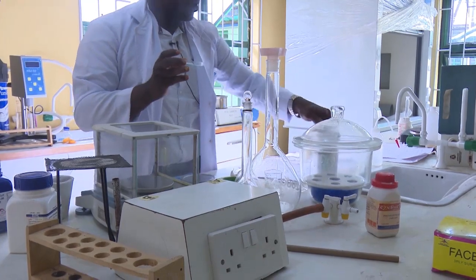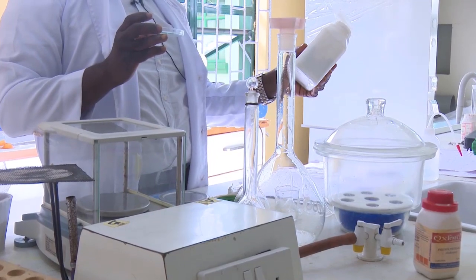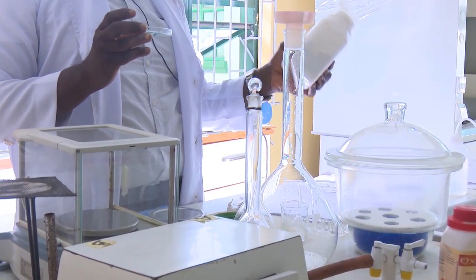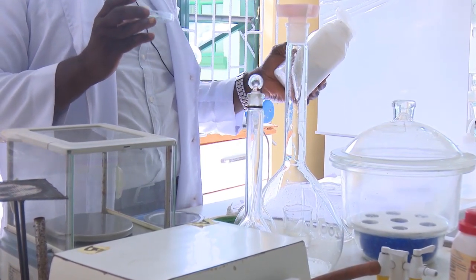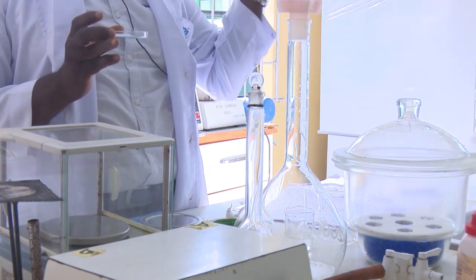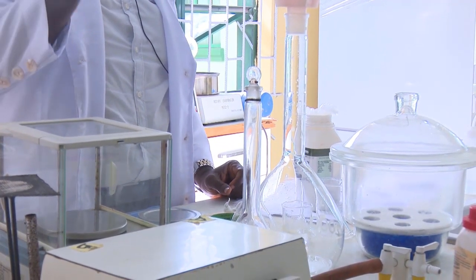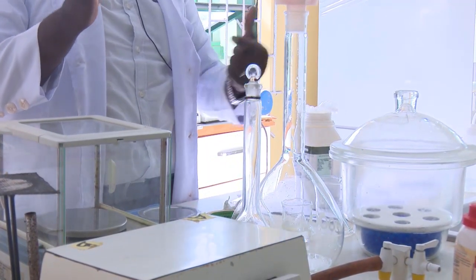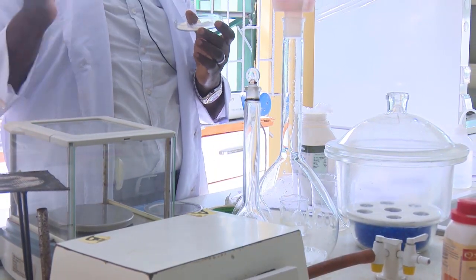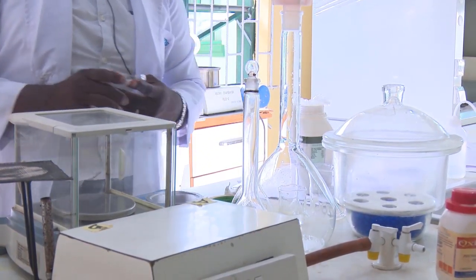If you look at the body of the plastic, we are told that the percentage purity of this compound is 99.5. It means that for it to be 100, something must be part of it. Therefore, that likely is water. For us to have 100% sodium carbonate, that is the reason we are taking this to the oven to have it dried. When we dry it, we measure it repeatedly until we have a constant weight. Once we have a constant weight of 106 grams, we take it to the lab for our preparation. Right now, we are going to the oven.